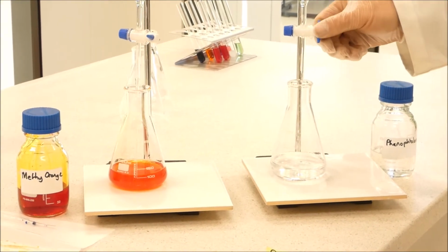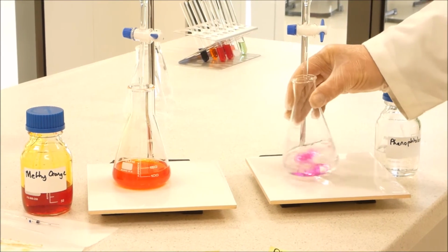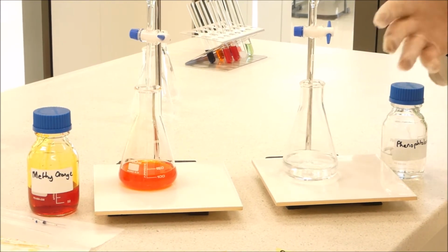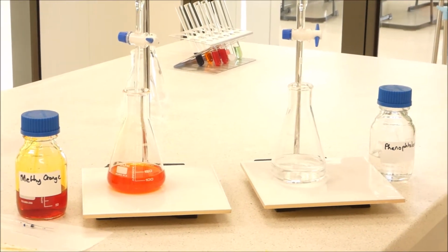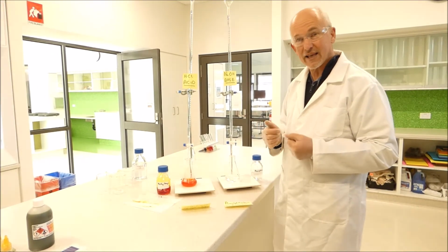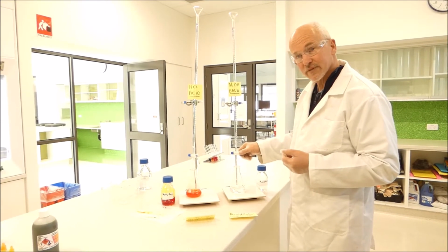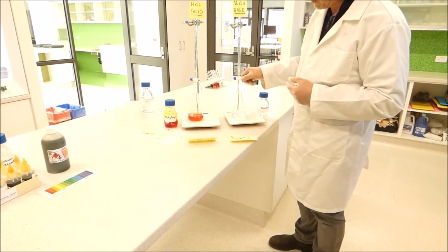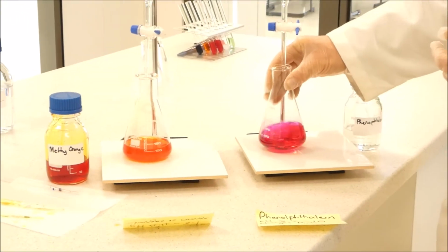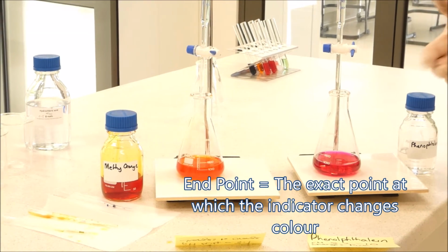So we continue to add very small amounts. It's staying pink a little bit longer. And in later chemistry, this becomes really important because the amount you add can tell you exactly how much of a chemical reaction has happened, or how far the chemical reaction has happened. So we'll continue to add. We'll add a few more drops. And this time the indicator has changed to a ruby pink colour, meaning that the endpoint has been reached.